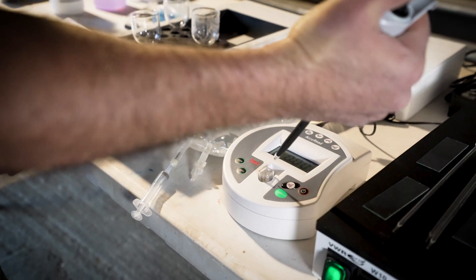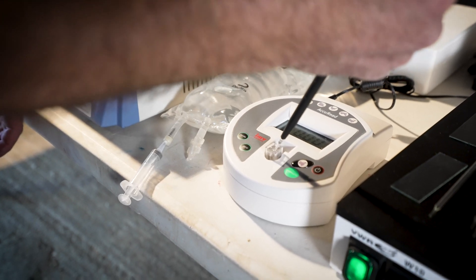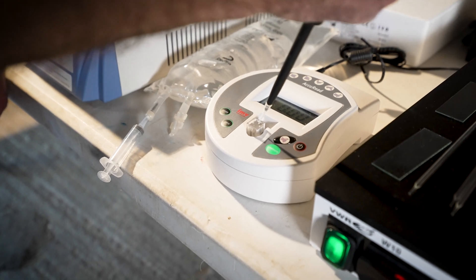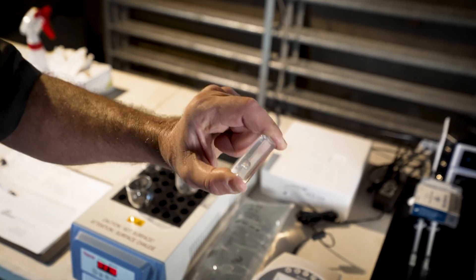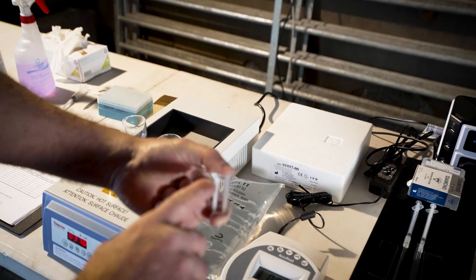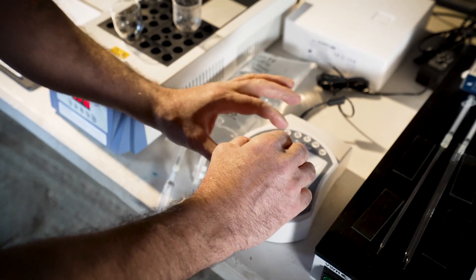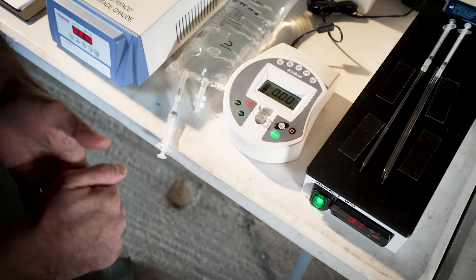We're going to put that in, and in a second we'll measure it. But before that, we need to shake the sample in a specific way. As you can see, the sperm is floating in it — it's now nicely diluted. We diluted it three times. There's a little arrow that needs to point at the front.